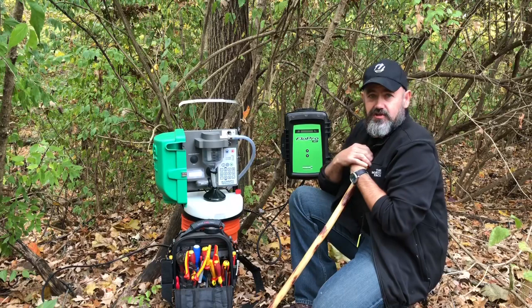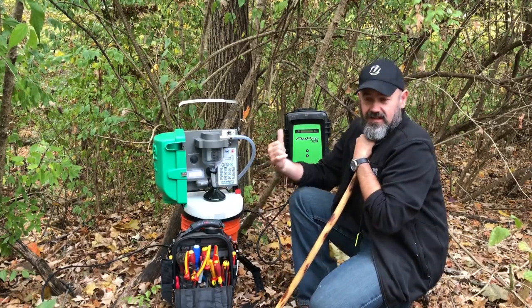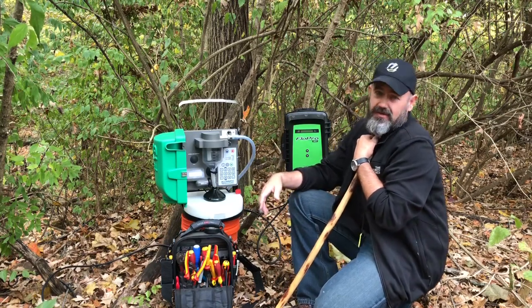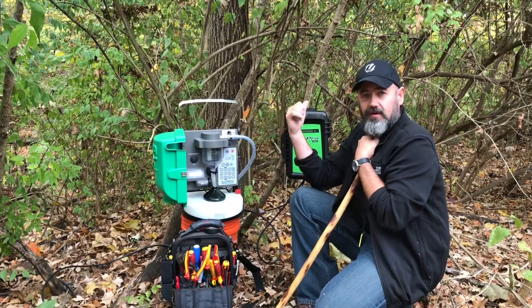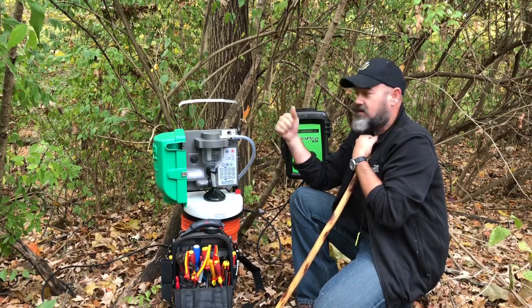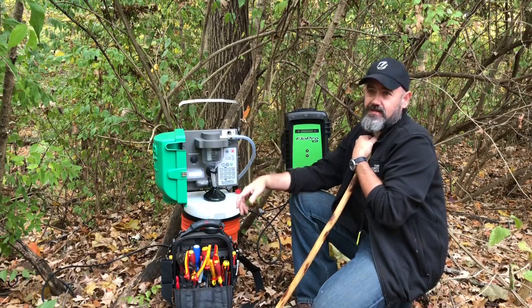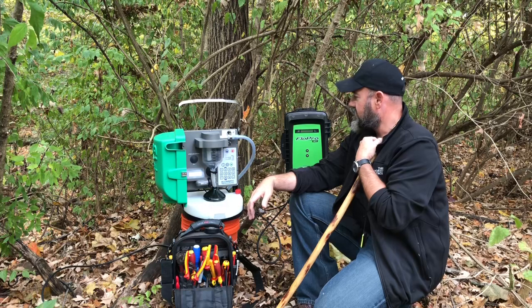In this case, it's in a stream, so we've done some gauging in order to determine what the flow would be across the particular cross section that we're measuring. It's going to be an approximation, but it'll be pretty close. So we're measuring that flow to correlate the amount of water that goes through the system during a rain event. This is the dry period, so we shouldn't have too much. So it should be a good time to actually get some reasonably good numbers.